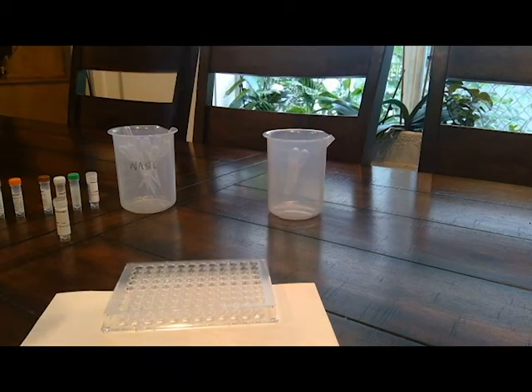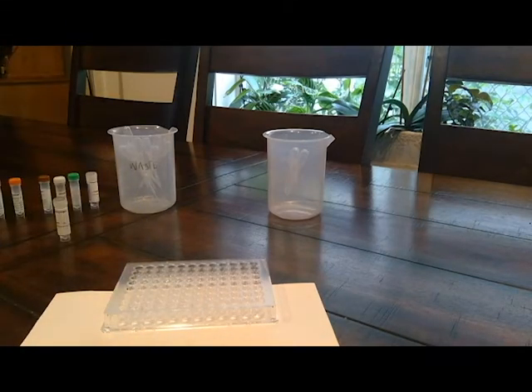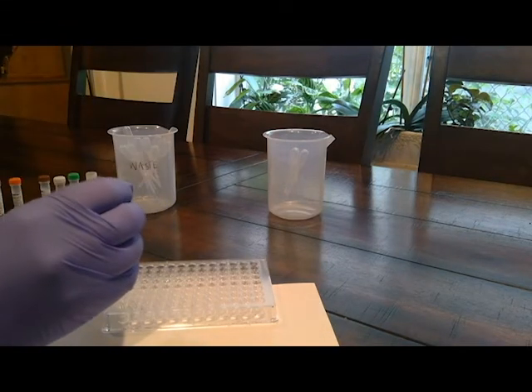And I suspect they only give you enough to do this once, so be careful. 3 drops. 1, 2, 3.